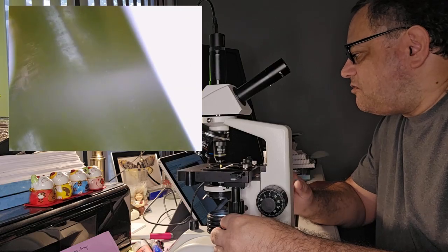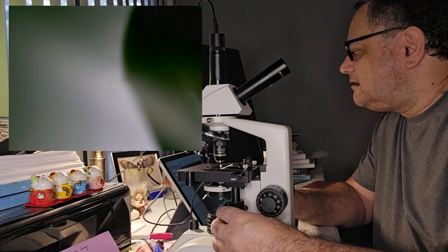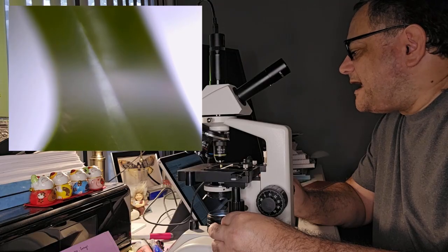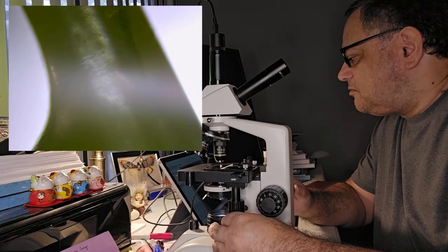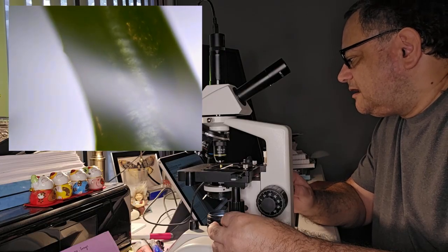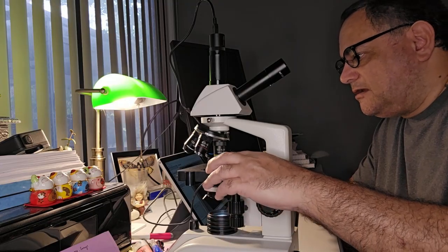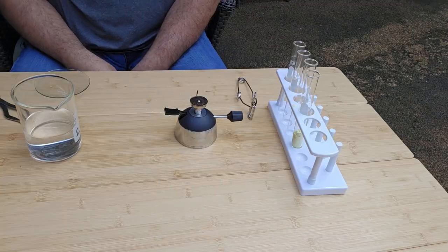crystalline form. You can see here, it might be better actually using a stereo microscope so you can see it from above. But this is just showing you roughly what to expect from a crystalline monoclinic specimen.